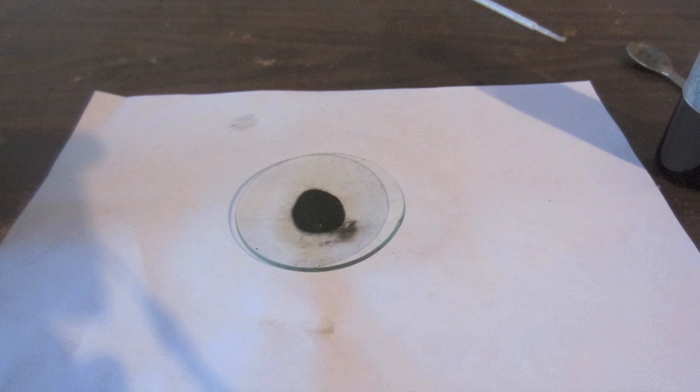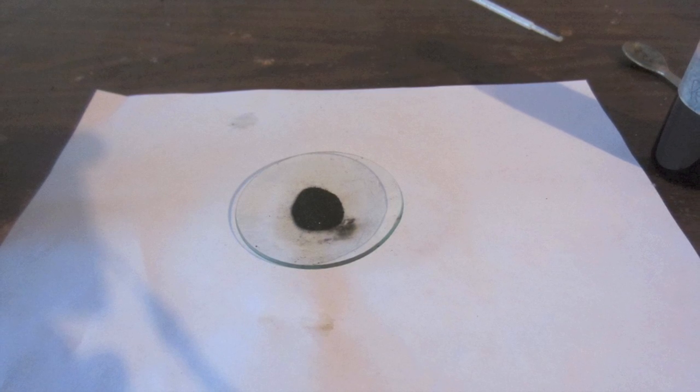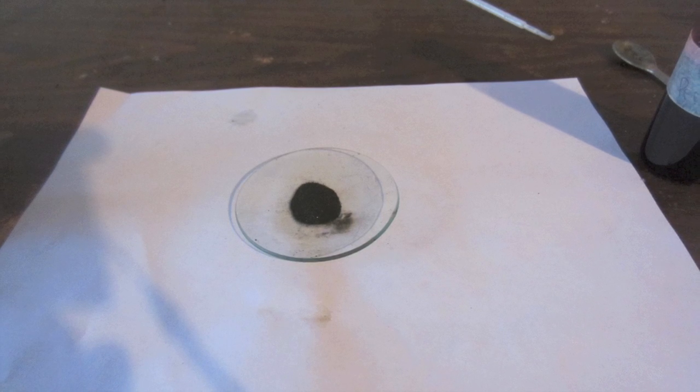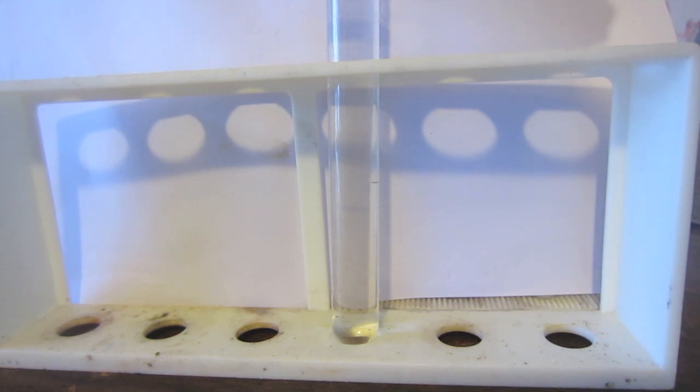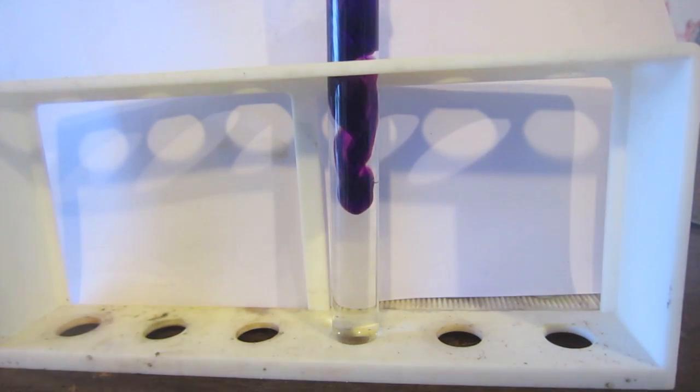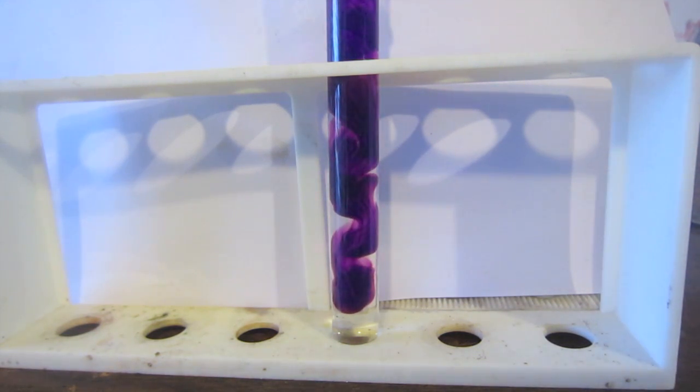The most common chemical featuring manganese in the +7 oxidation state is potassium permanganate. As a solid form it's an unassuming blackish powder, but in solution it is a beautiful pinkish purple color. Here I am pipetting some into a test tube full of water. I'm not going to show you how you make potassium permanganate because it's very very common and you don't have to make it. It's actually the starting point of a lot of other oxidation states I'll be showing you.